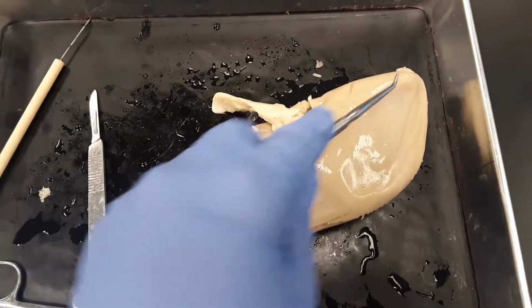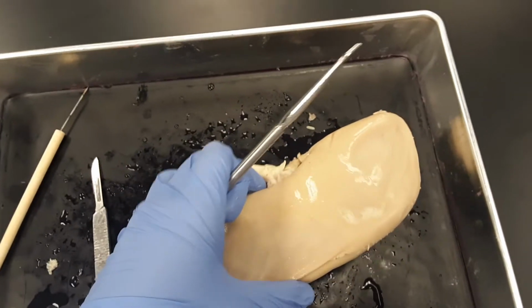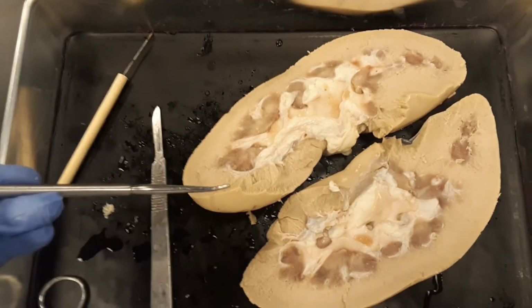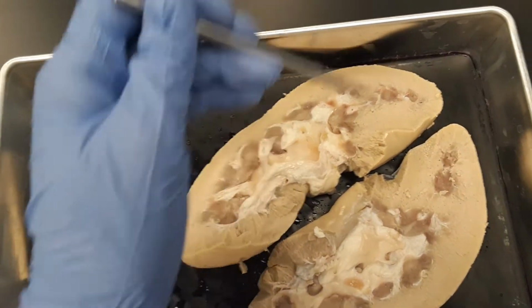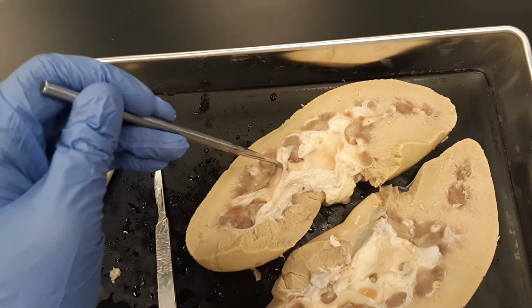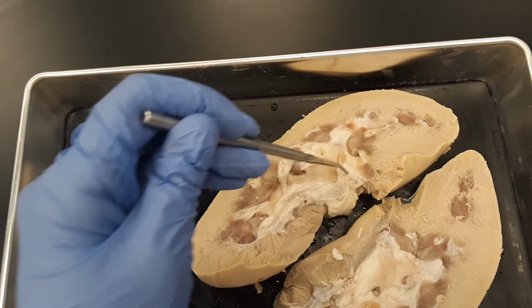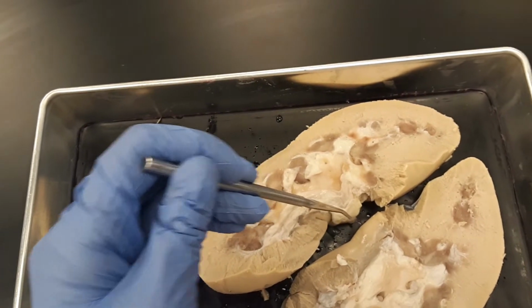To the kidney. So this is the outside of a kidney. We see a ureter coming out right here. So we're going to open up that kidney. First let's start with regions. The outer rind region, this is the renal cortex. This inner region here with the pyramids and the calyces is the medulla. And then right here where we see this curve of the kidney is the hilum. So this region is the hilum.